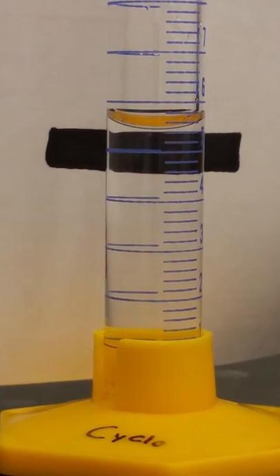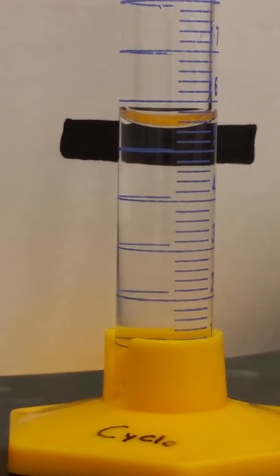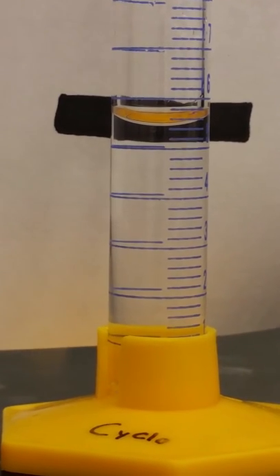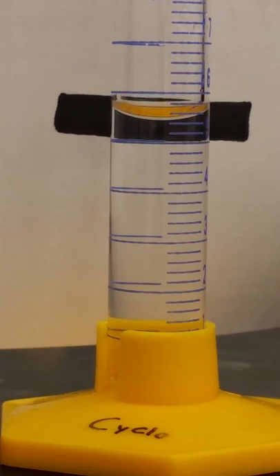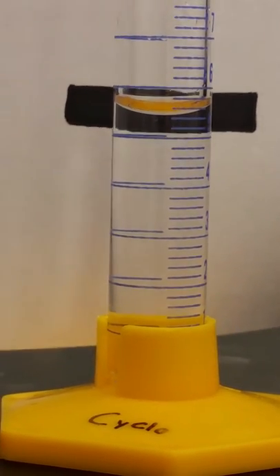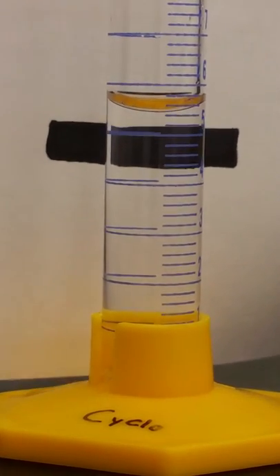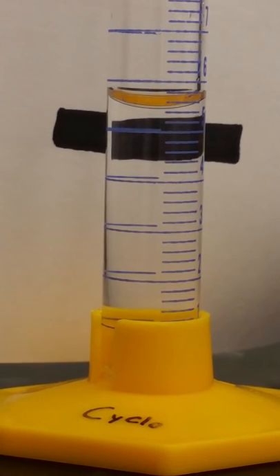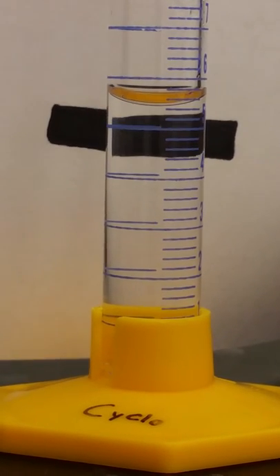So this is 0.2, this is 0.4, that's 0.6, 0.8, and the next number would be 6. So I think it's going to be about 0.4. So right now I'm at 5.4.